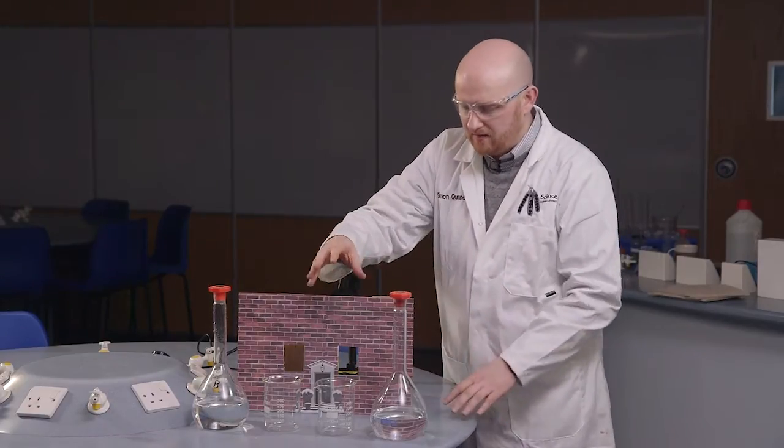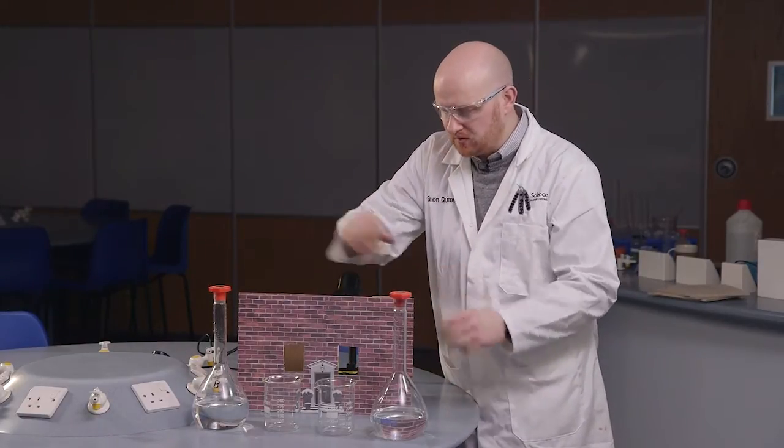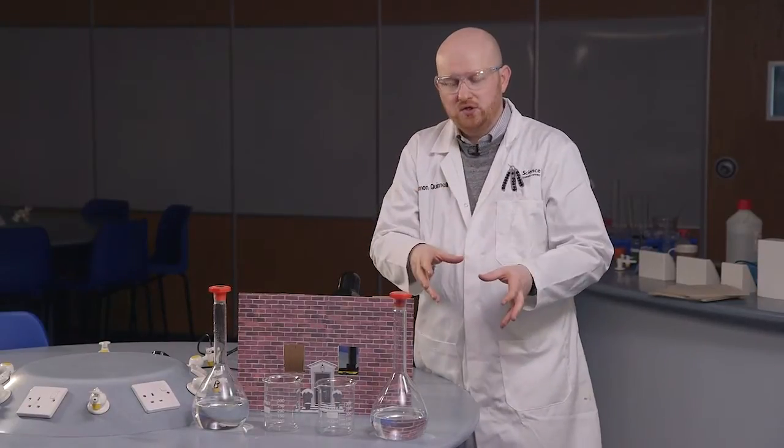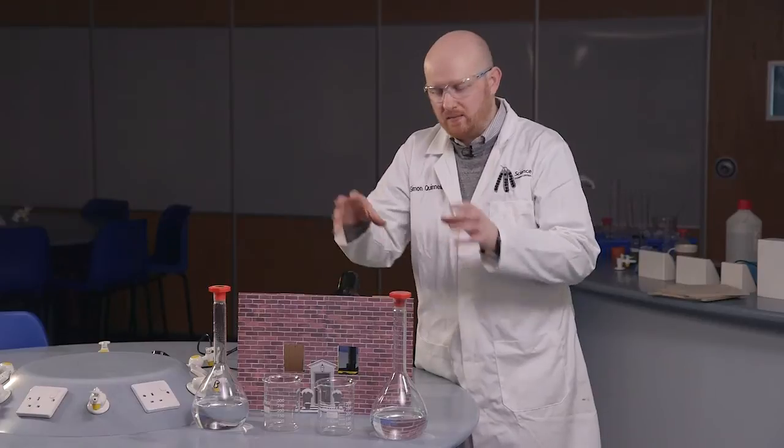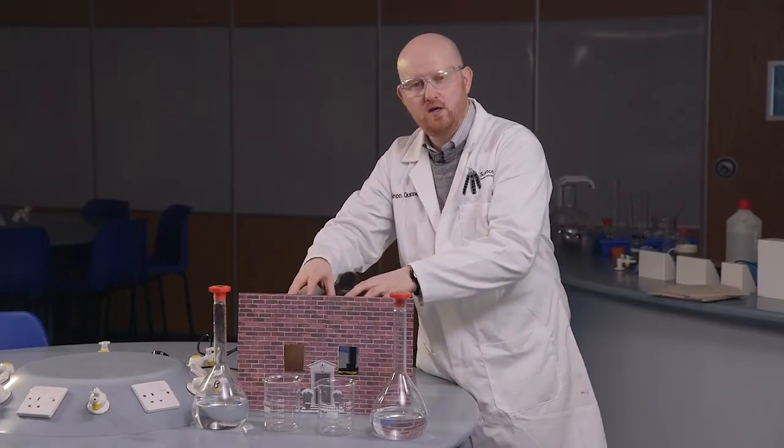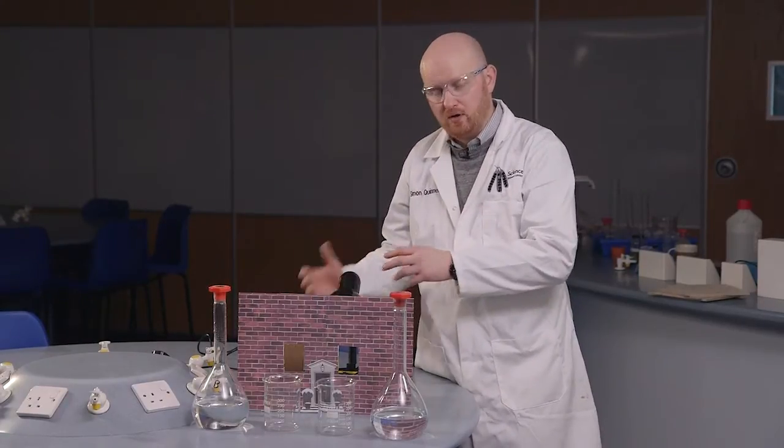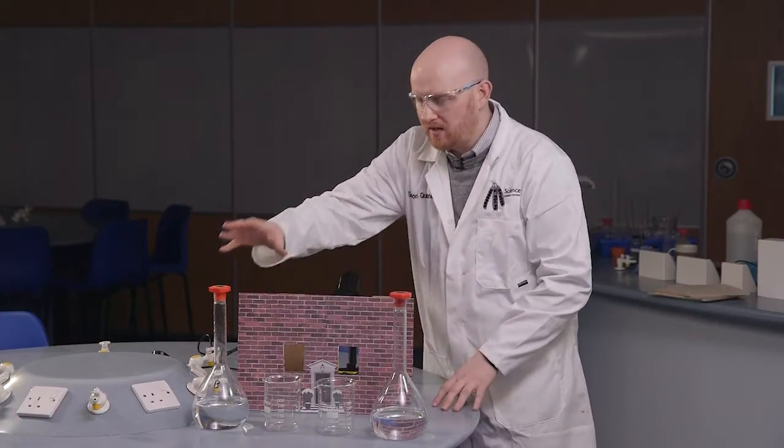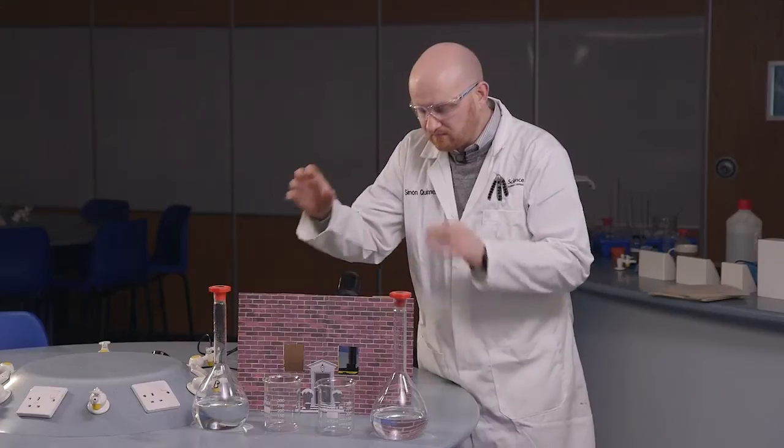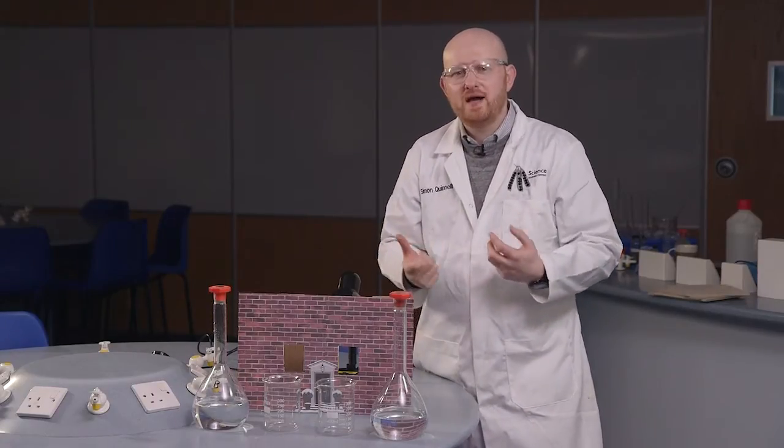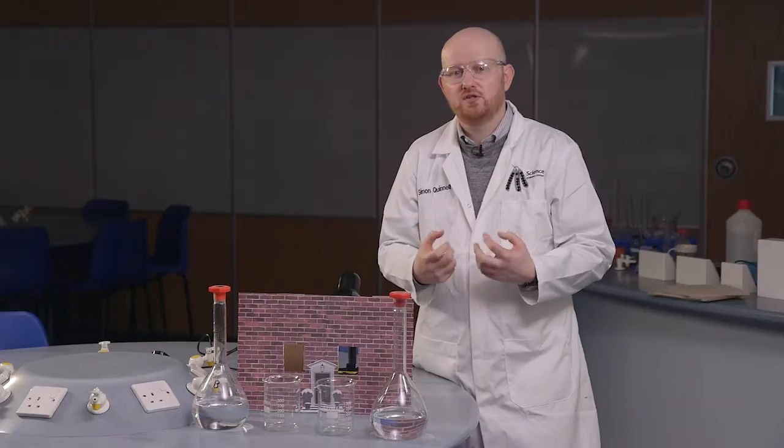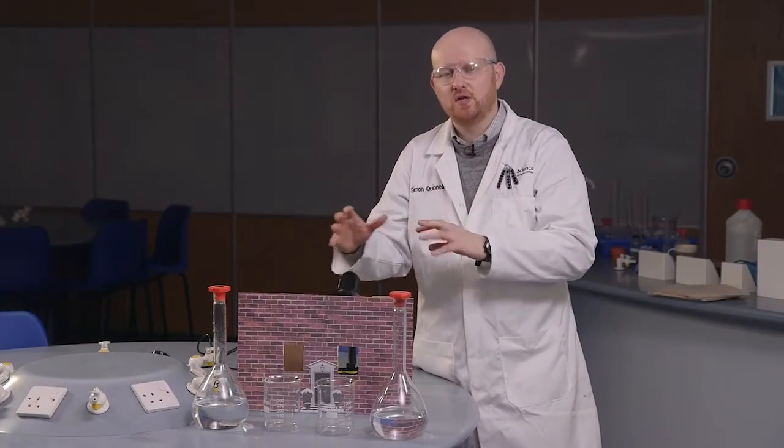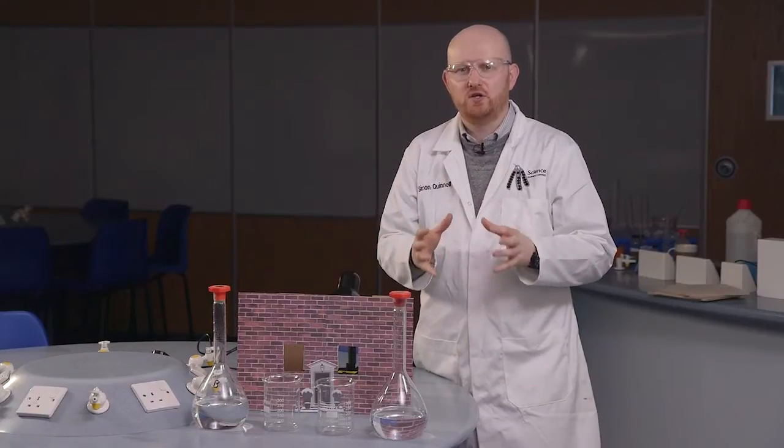So we have our light shining through there and I'll just turn this off for a moment. And at the front here we have two beakers and the two solutions we've mentioned. Now we're going to put solution A into our beakers, then place those beakers behind the windows here with the lamp on.